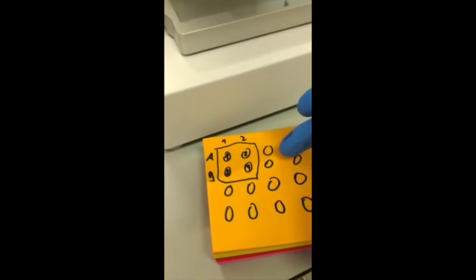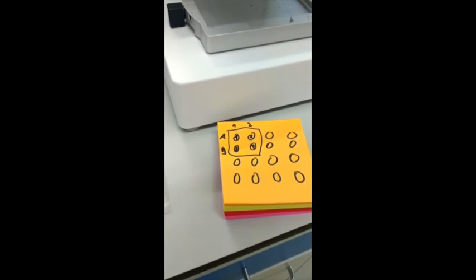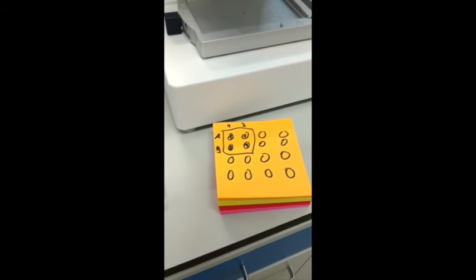You should always put it like that, because then when we go from manual pipetting to automatic pipetting, you don't need to make changes on the plate setup or anything else. Always put the quadrants and mark first here, second here, and so on.